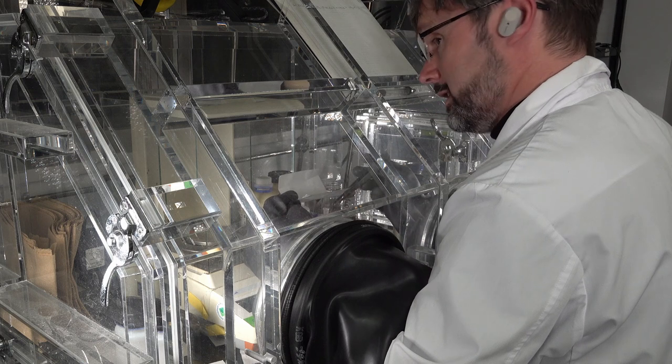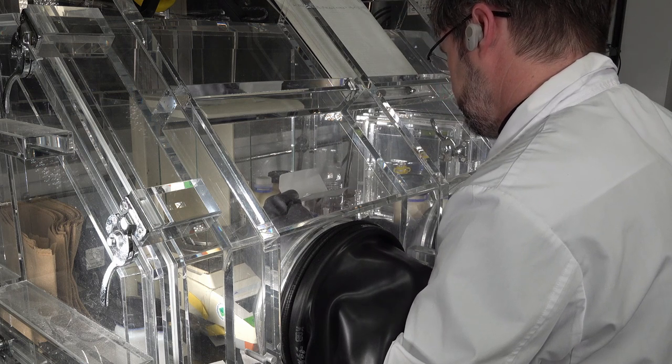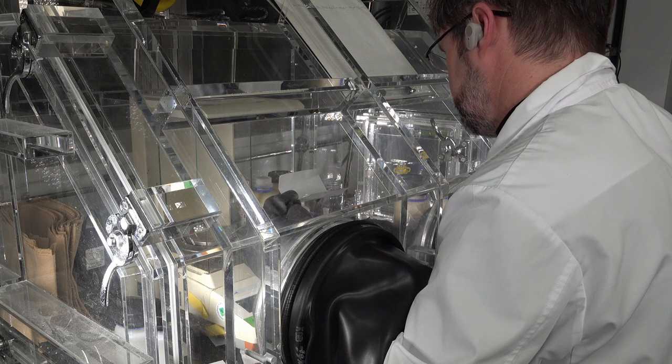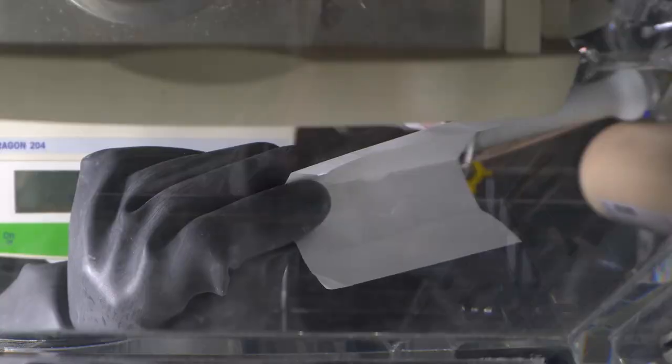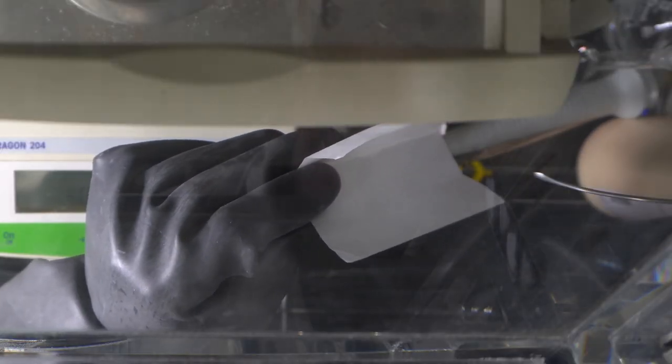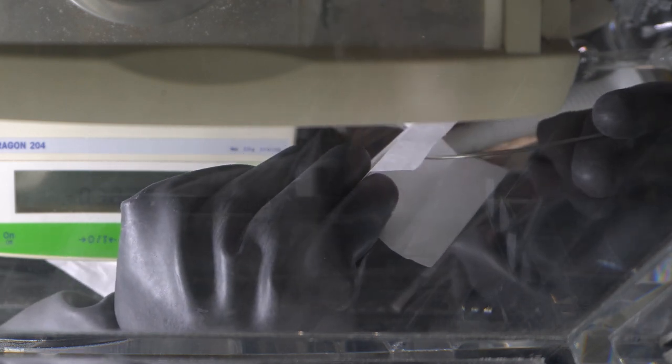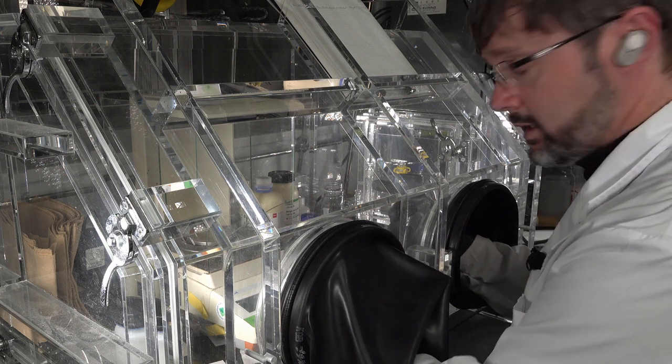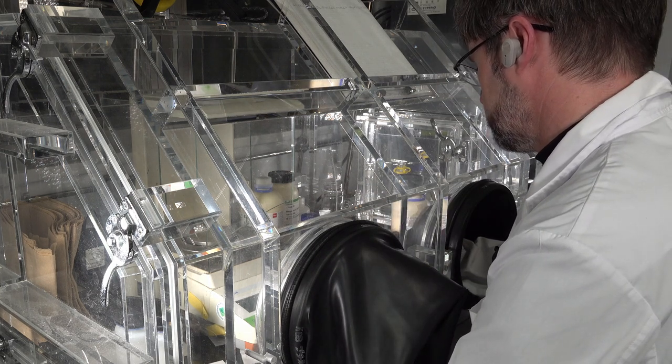Let's do the sodium sulfite. This one's tough. I'm weighing out literally tenths of a milligram now. So I spilled the flask with the sodium hydrogen sulfite in it. Luckily this is a volumetric flask, there was no solution in it yet, so that didn't spill out.